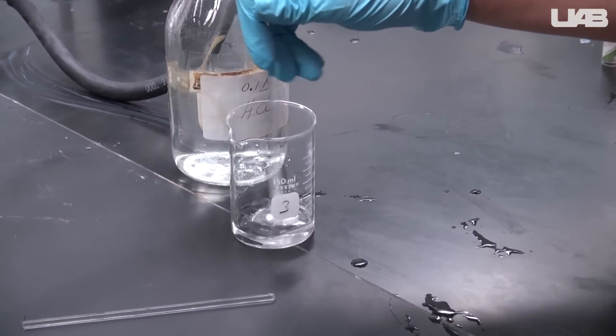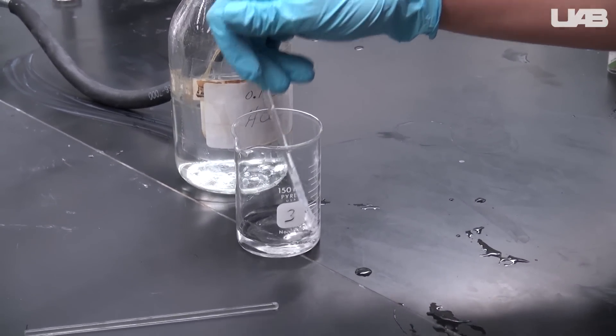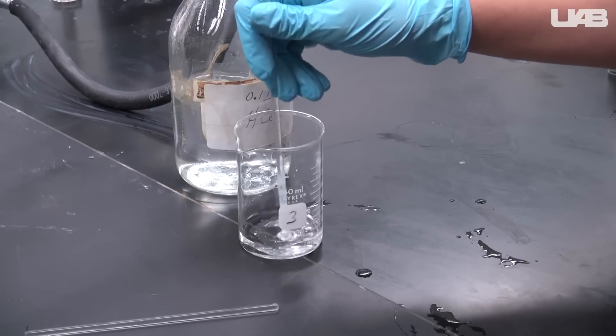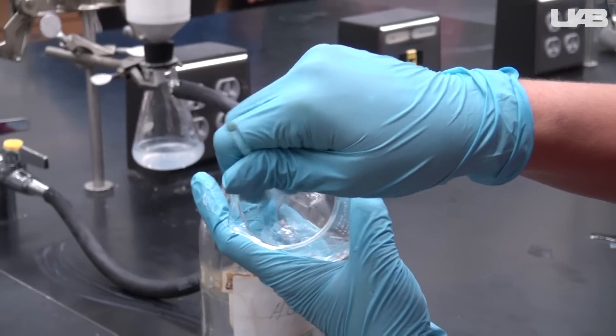In exercise 2, you will need beakers of less than 10 mL of each different acid. Try to dissolve a small amount of your solid in each one.